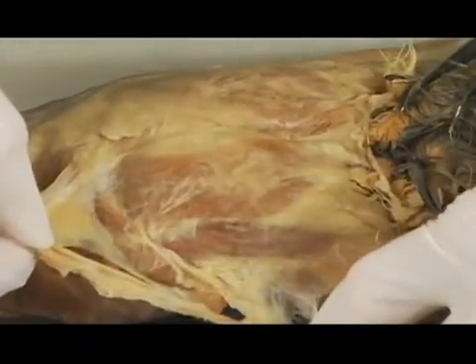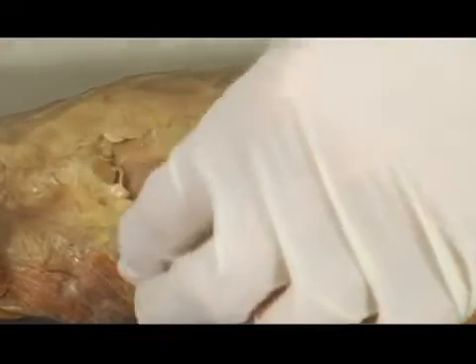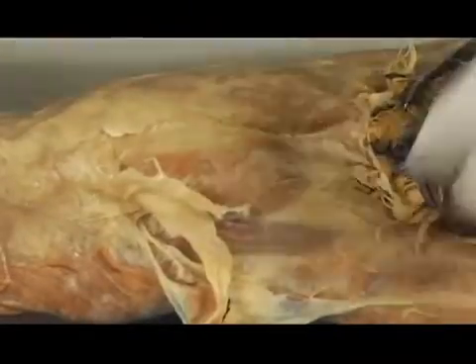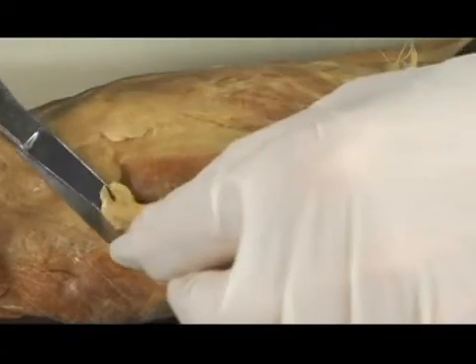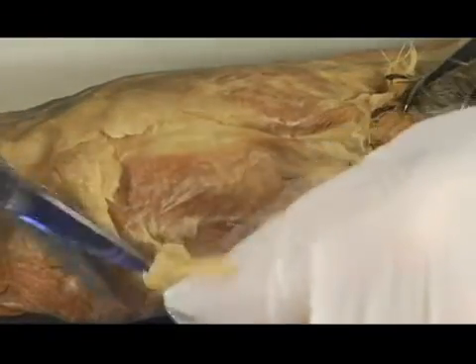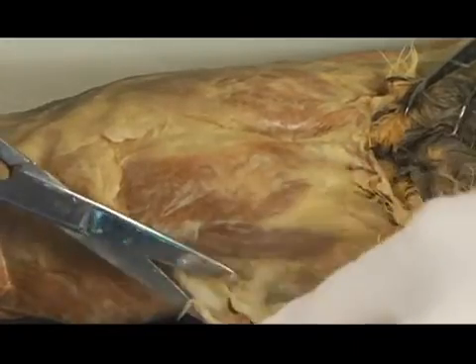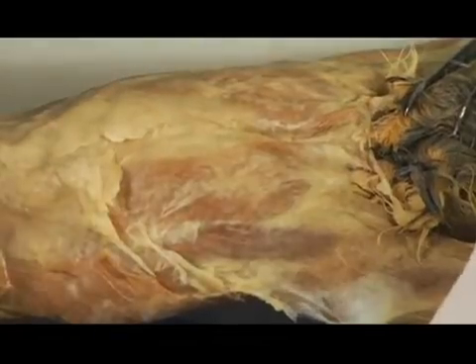Okay, I removed quite a bit here. You can kind of see it there. I could tear it, and that might work, but I'm also going to use my scissors now, since I've got quite a bit of tissue I know that I don't need. I'm going to cut kind of along the edges of that. There's a little bit of muscle there, but that actually is from the skin, so that's okay. I'm going to cut down along there. And, okay, a little bit more here, pull that off.